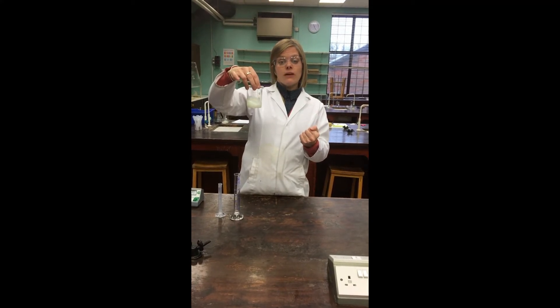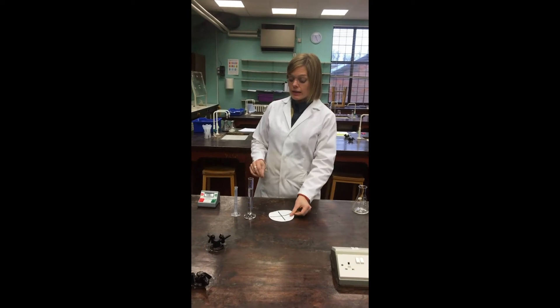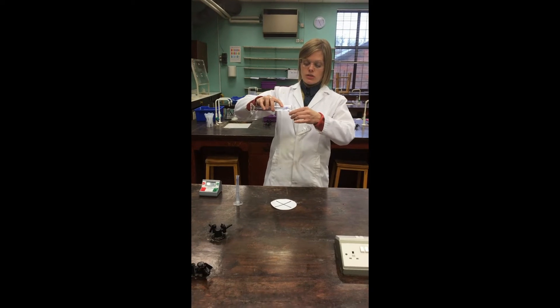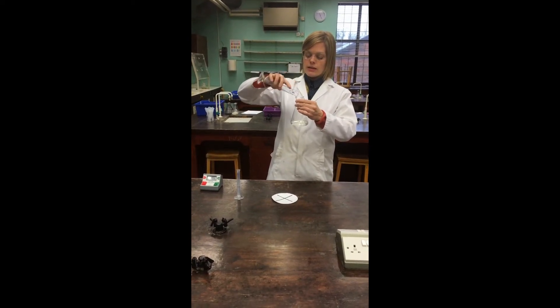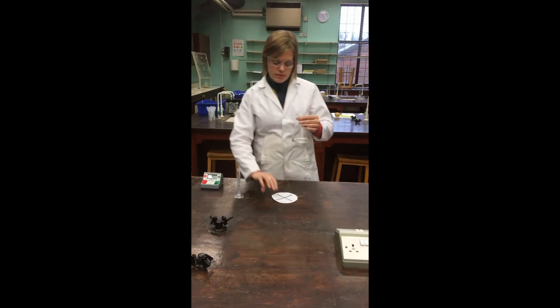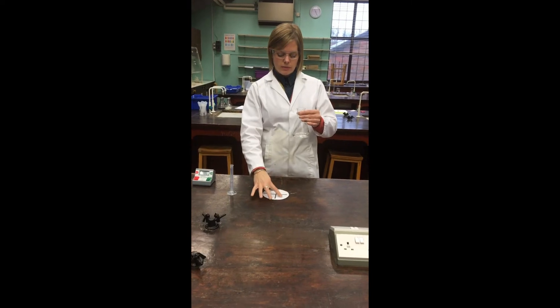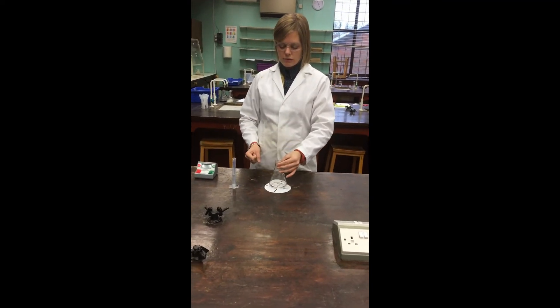Let's modify this method. This time I'm going to add that sodium thiosulfate solution, which again I've measured out, into a conical flask. The conical flask I'm going to stand on a piece of paper which has got a cross drawn underneath it, so that cross sits underneath the flask.